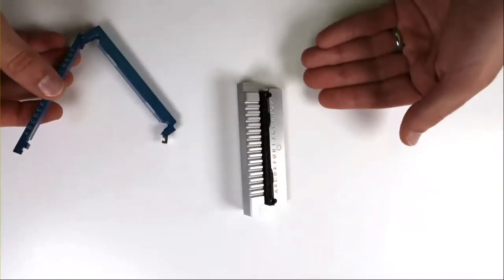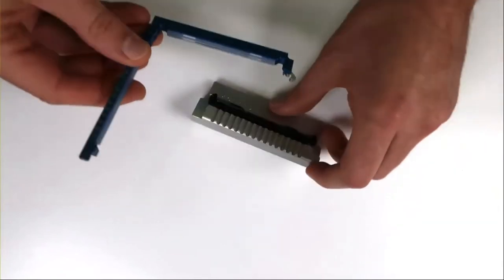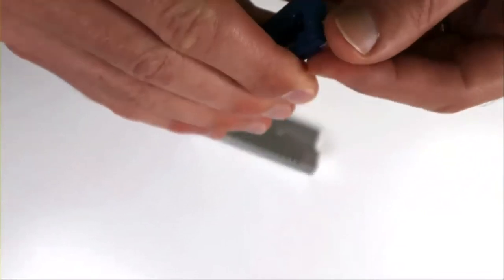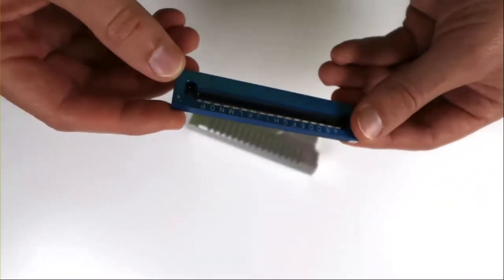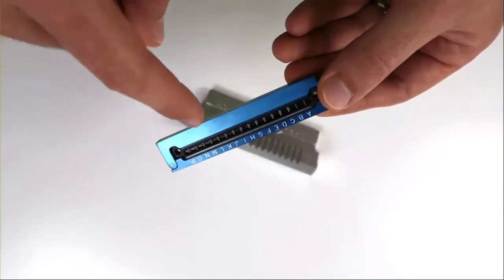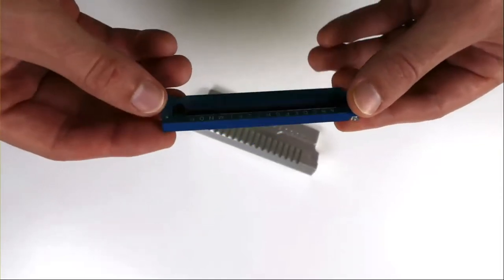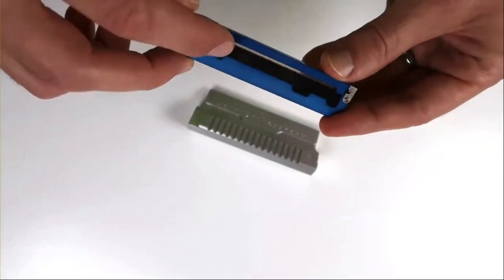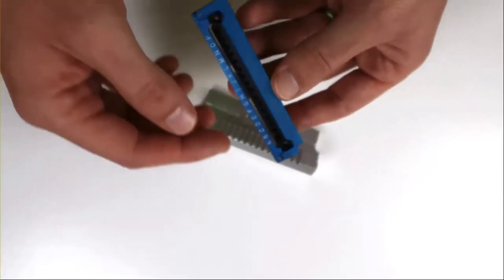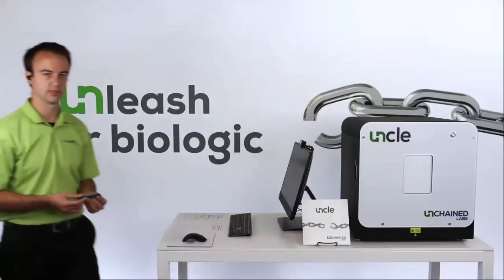Now I have samples loaded in my Uni, and the next step is to seal them in the blue Uni frame. All we do is a quick swoop and lock. Now I have my Uni with my samples in it and silicone gaskets on either side sealing my samples — so I don't have to worry about leakage or evaporation. The Uni is still going to be in contact with the heating surface once I load it into the UNCLE. Let's take this Uni back to the UNCLE and see how the rest of the experiment is operated.